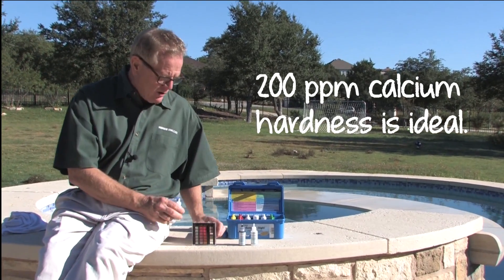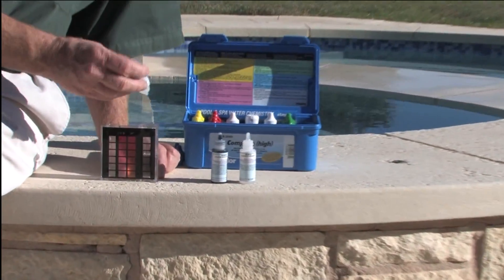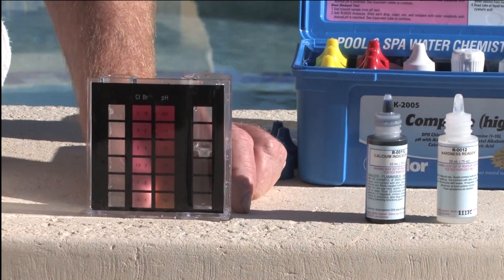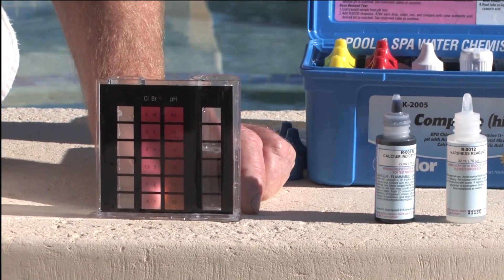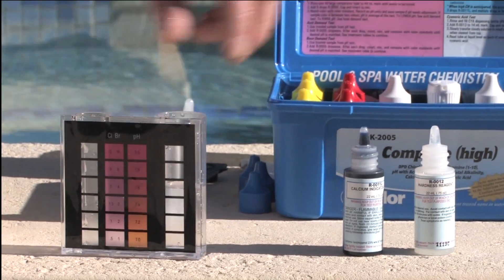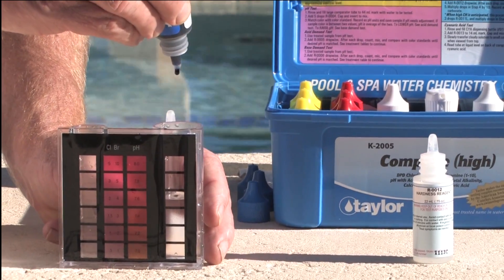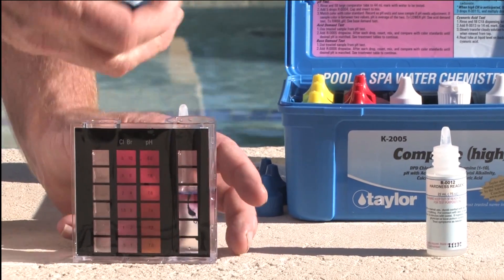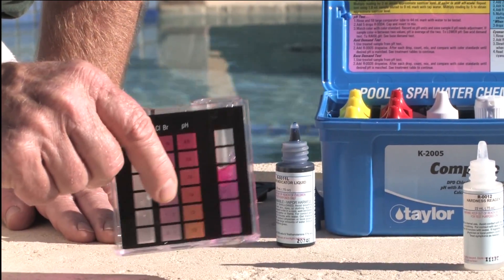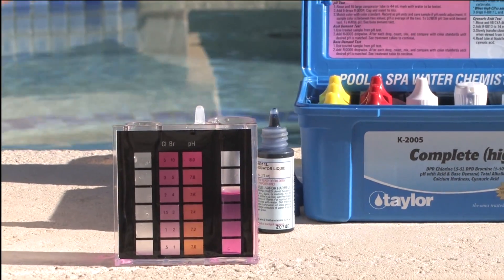So let's test. We fill the vial to the 25 milliliter mark and with reagent number 10 we put 20 drops in. Swirl it around. Five drops of reagent number 11 — it's a very thick reagent so it'll take some swirling to get it mixed up. This is a titration test just like total alkalinity. We start off with a nice red color and we're going to titrate it till it goes blue.